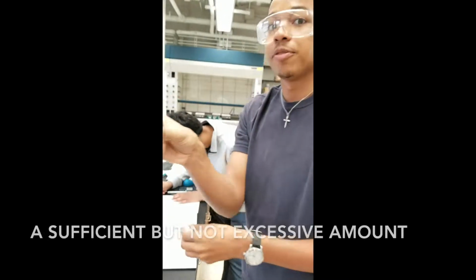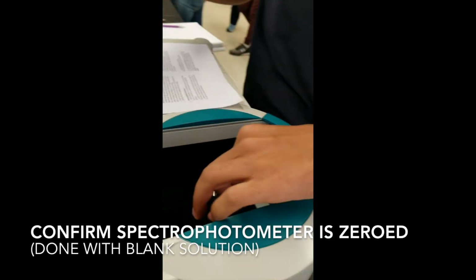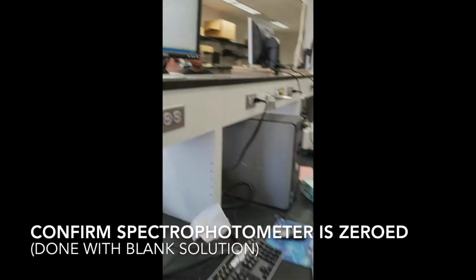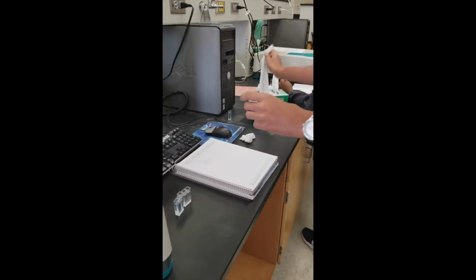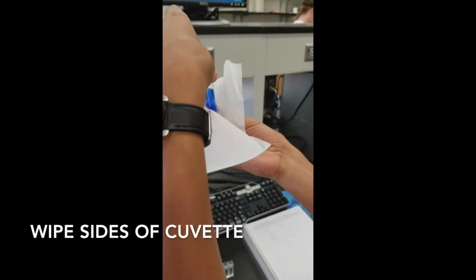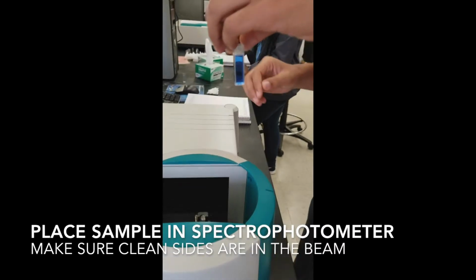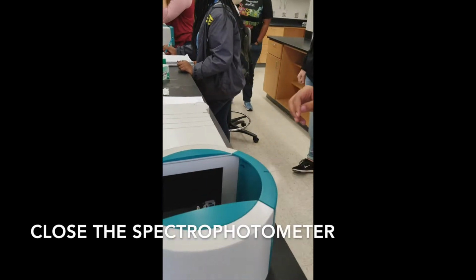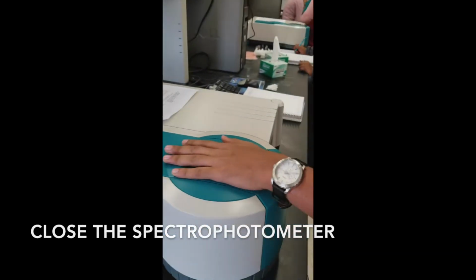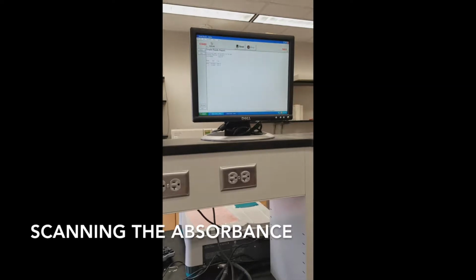Right, so as you can see, it's been filled up to the line, and this is what we're going to put into the spectrophotometer, between the two sides that the light will pass through. Okay, so now we're going to place it into the spectrophotometer. Make sure it's firm. Now we're going to close it. And then we're going to click read. Wait for a second.